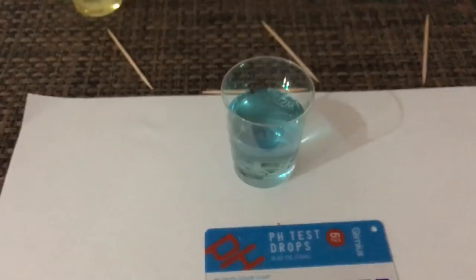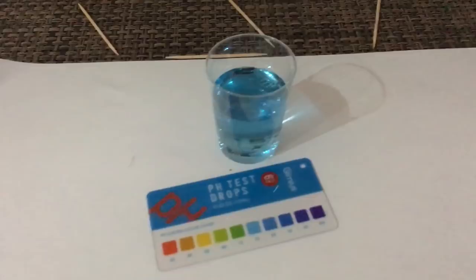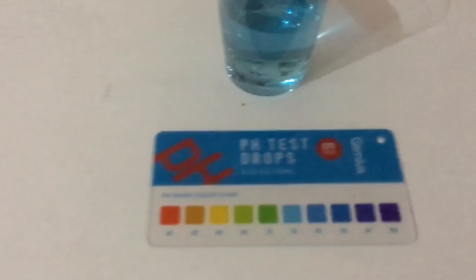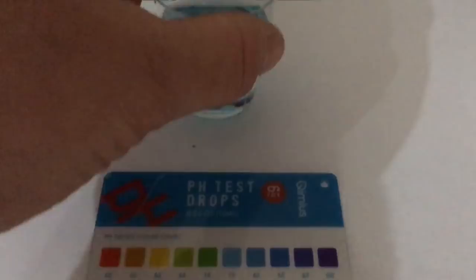Krumbach — also a small disclaimer: this is exactly the water that I do drink, not just natural but medium. That is the water we purchase at home. And this one has a beautiful color — I would also say 7.6 to 8.0, because it is a little more blue than normal.